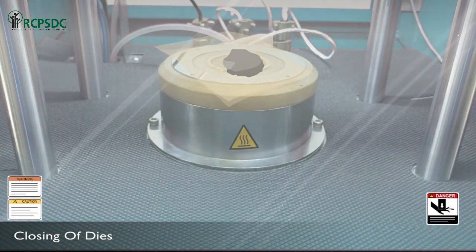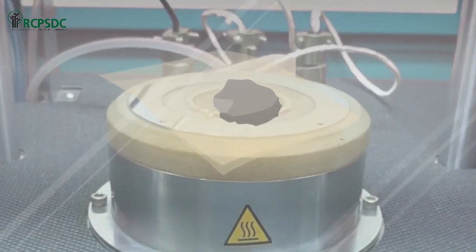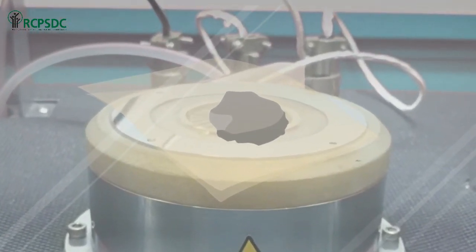Please ensure to close the machine's safety door before starting the test. Please ensure that test specimen is placed in the middle of the lower die.